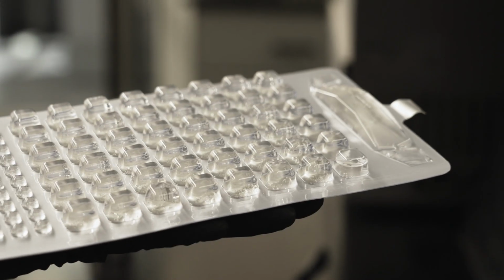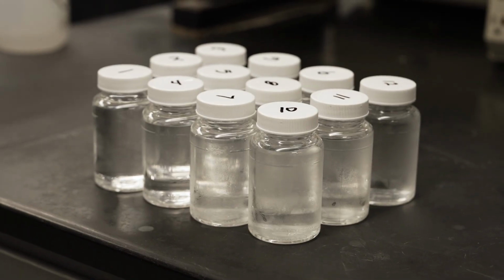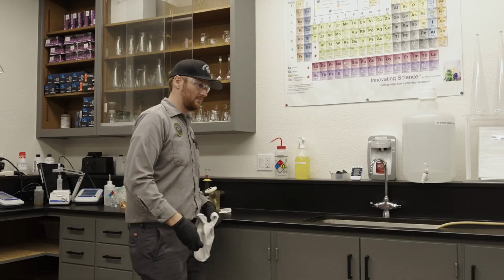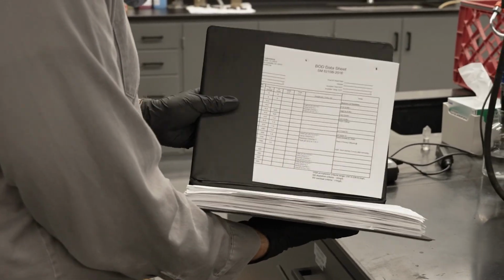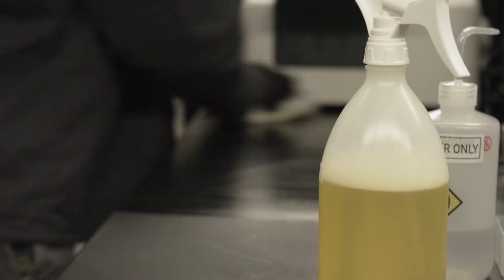We'll bring the samples back, log them in, and begin analyses. Sometimes, depending on what we are testing for that day, we'll be analyzing samples pretty much the whole day, or sometimes it will only be for a couple hours. When we do have slower days testing-wise, we'll spend the rest of the day catching up on quality control tasks, reviewing data, writing operations or regulatory reports, cleaning equipment, or anything else that needs doing.